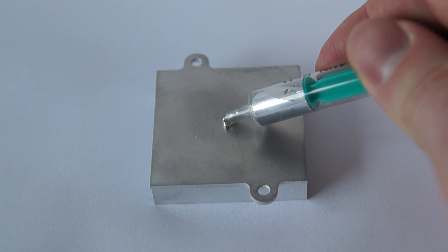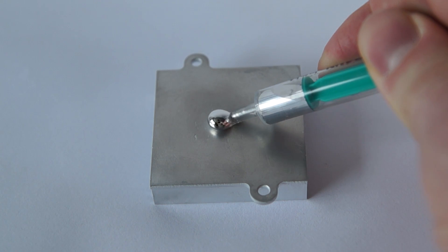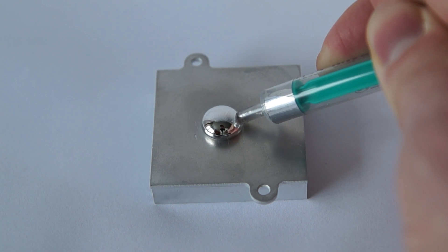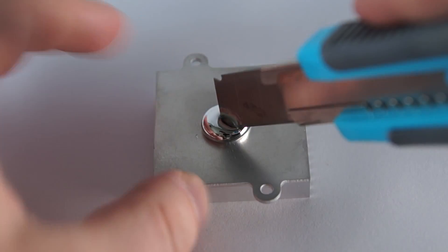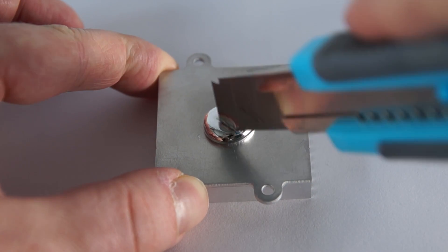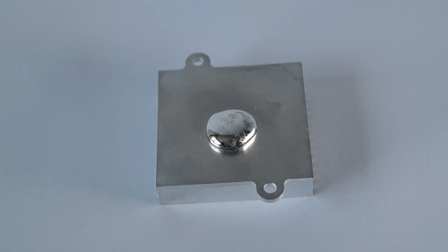Let's take the aluminum radiator from a computer and drip about 2 grams of liquid gallium onto it. To speed up the reaction of gallium with the aluminum, its surface was scratched with a knife.